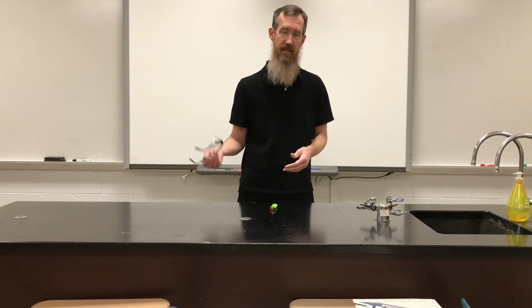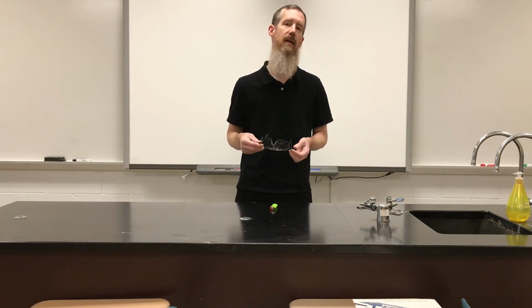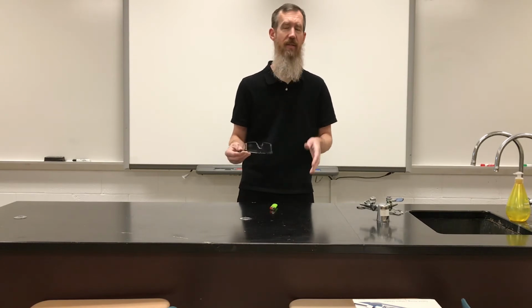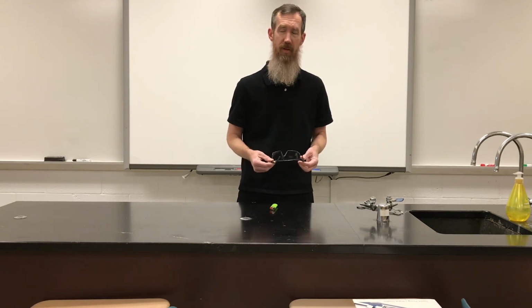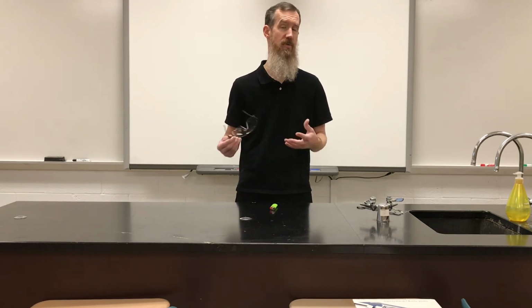So in this case, we had magnesium. We burned it with the oxygen that existed in the air, and we made magnesium oxide. Again, in our data sheet, we're going to see how we write that, and we're going to explore that a little bit more. We also, of course, when we do chemical reactions, need to explore what the reactants look like beforehand and what the products look like afterwards, and we identify the change that happened. And in this particular case, the change was quite dramatic because we had a very bright, white, hot light.